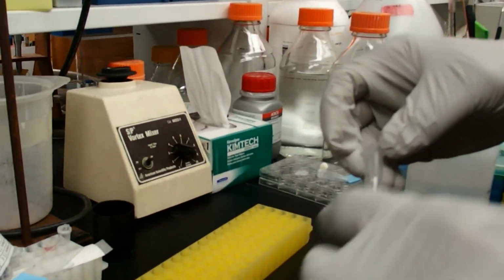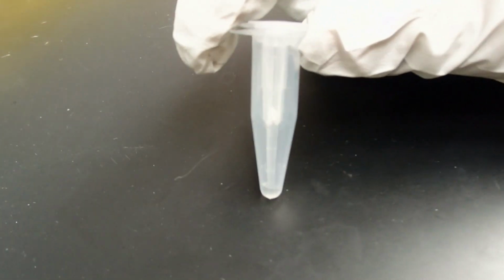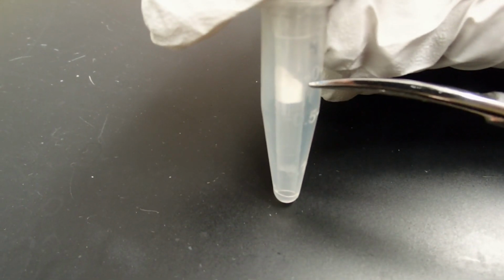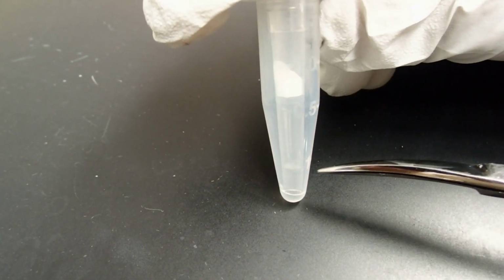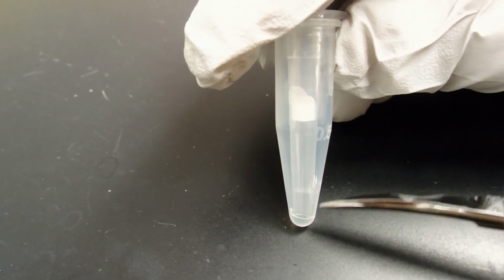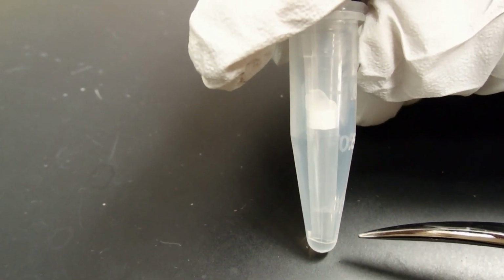I'm going to show you each one at a time. If you look here closely, you can see that the agarose has stayed on top of the filter and all the liquid with the DNA is on the bottom there. For the bigger filter tip, you can see a big chunk of dried up agarose right there on top of the filter and a bunch of liquid here. You'll notice that with this one, there's a lot of liquid outside of the tip but a whole lot inside of the tip too. This is the undesirable part of using the bigger reservoir.